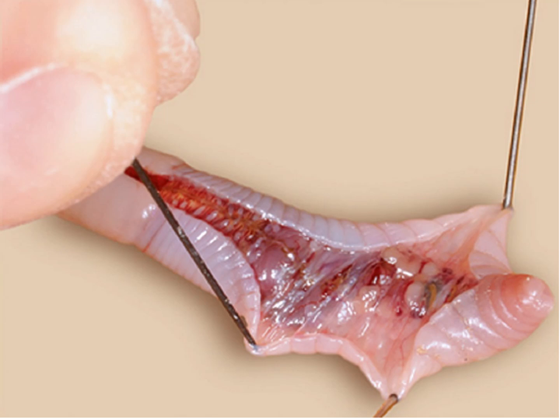We have to spread the skin, and by using a needle we can tease these fibers that are attaching the skin to the internal septa. We have to remove these with the pin, so that the skin gets clear from the internal organs, and then place the pins.